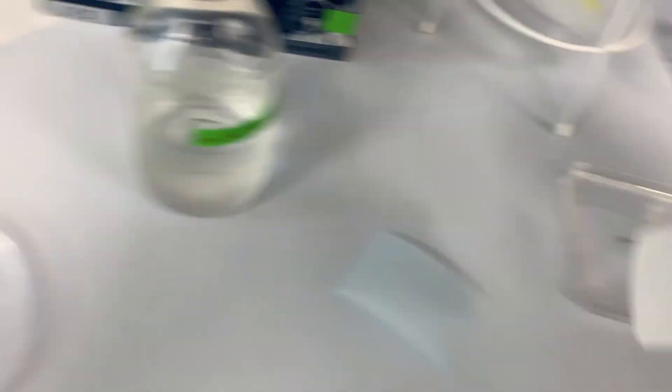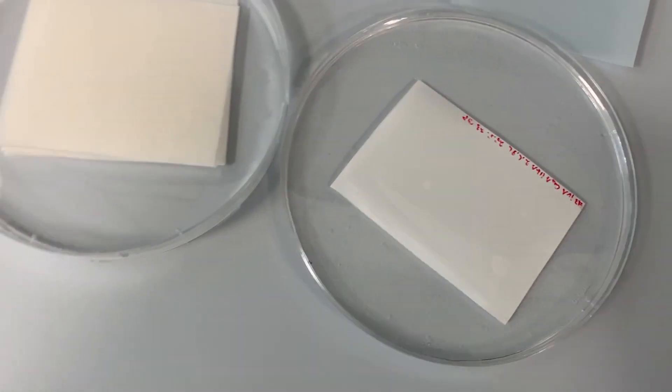Now I transfer the membrane to the buffer and I incubate everything for 5 minutes in the buffer.